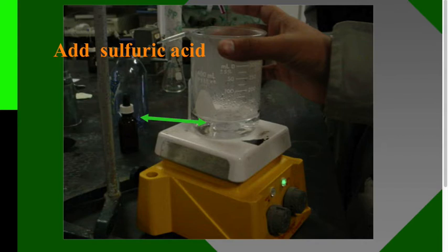There's a really crucial step: this redox equation occurs in an acidic environment, so you have to add sulfuric acid. The instructions tell you to do that—don't forget.